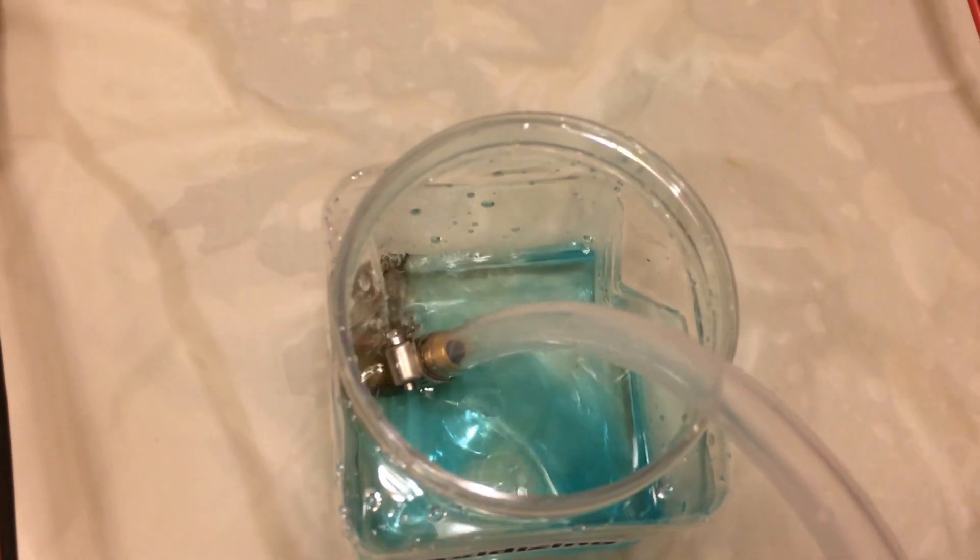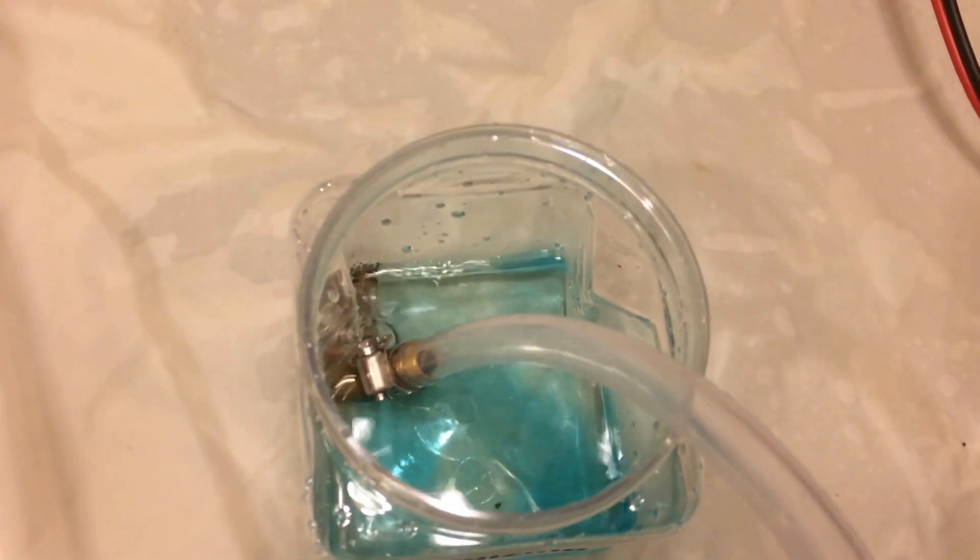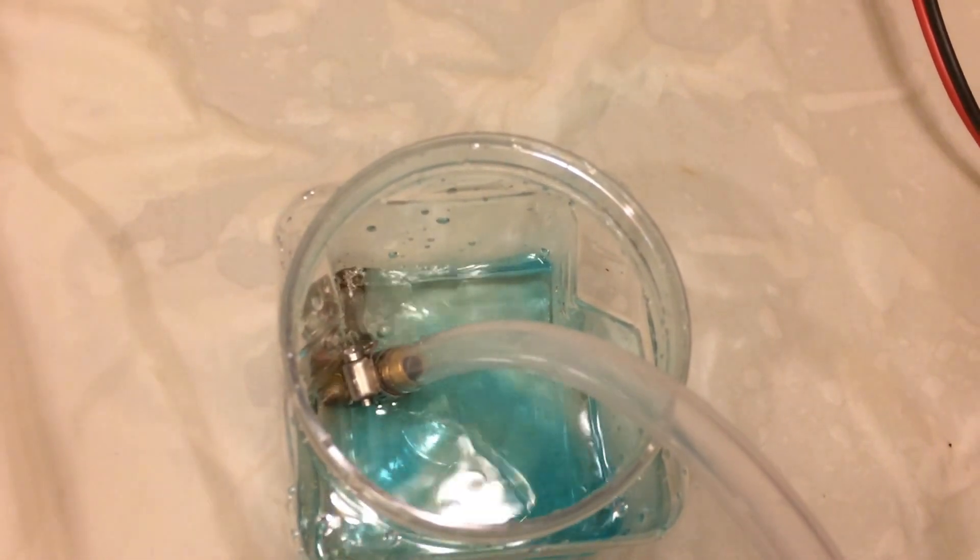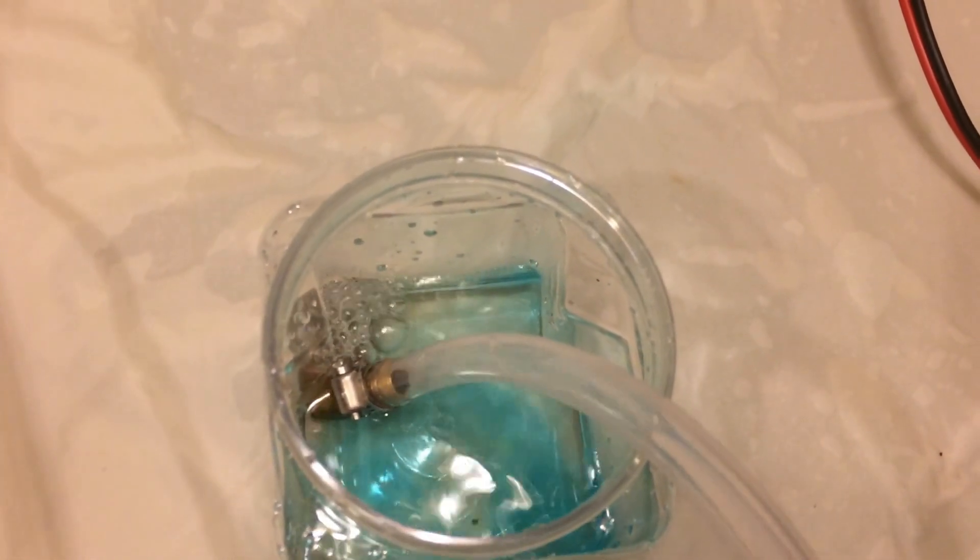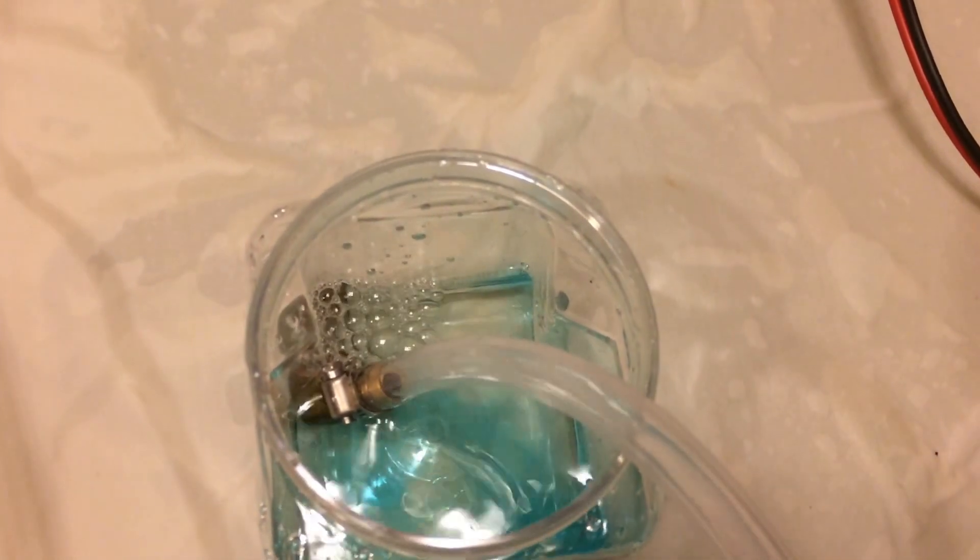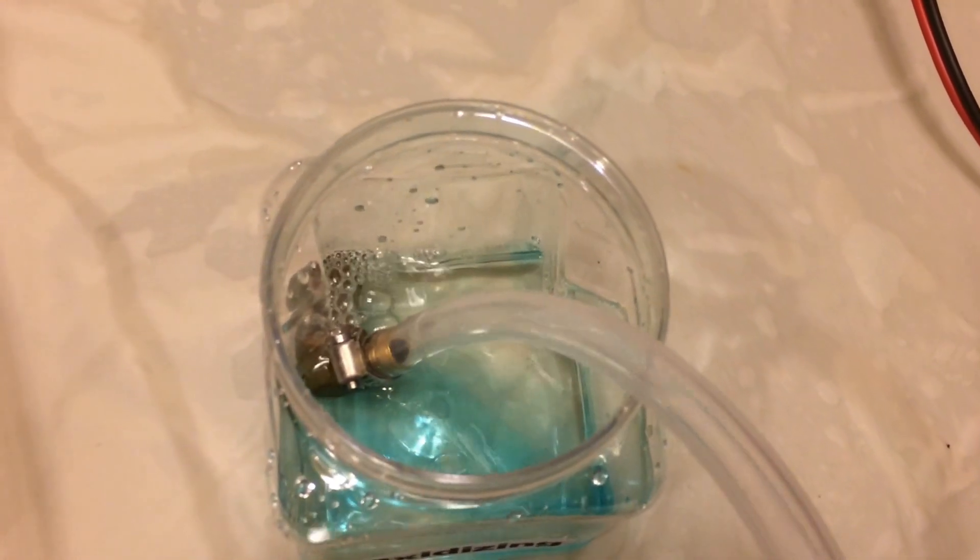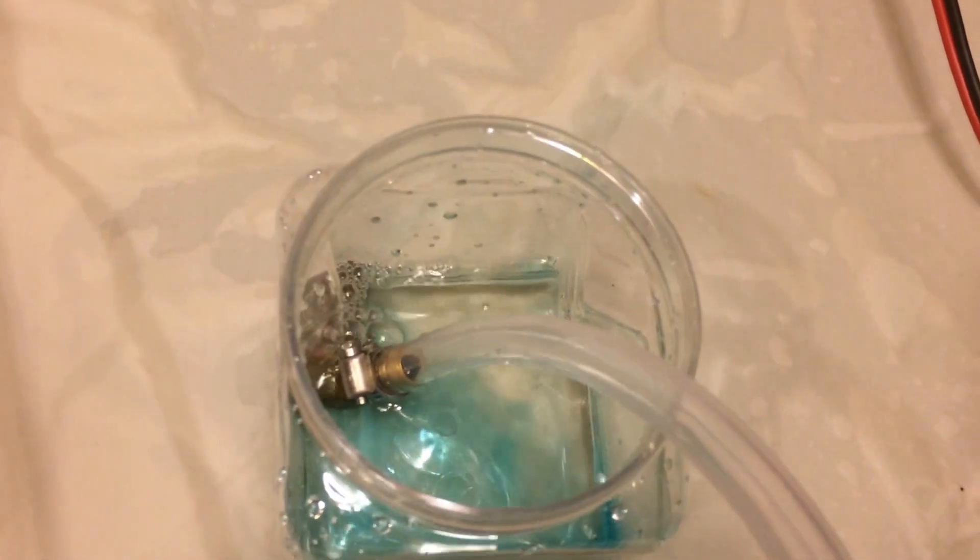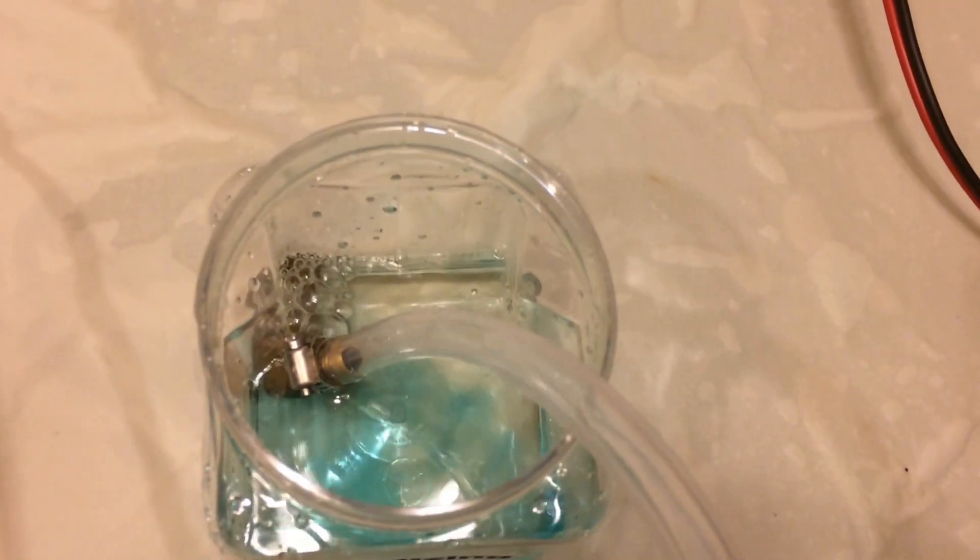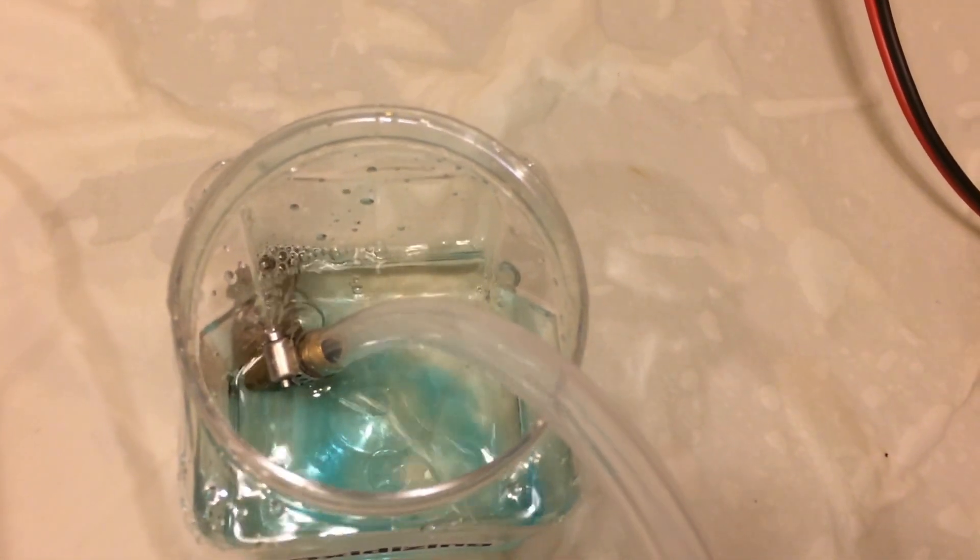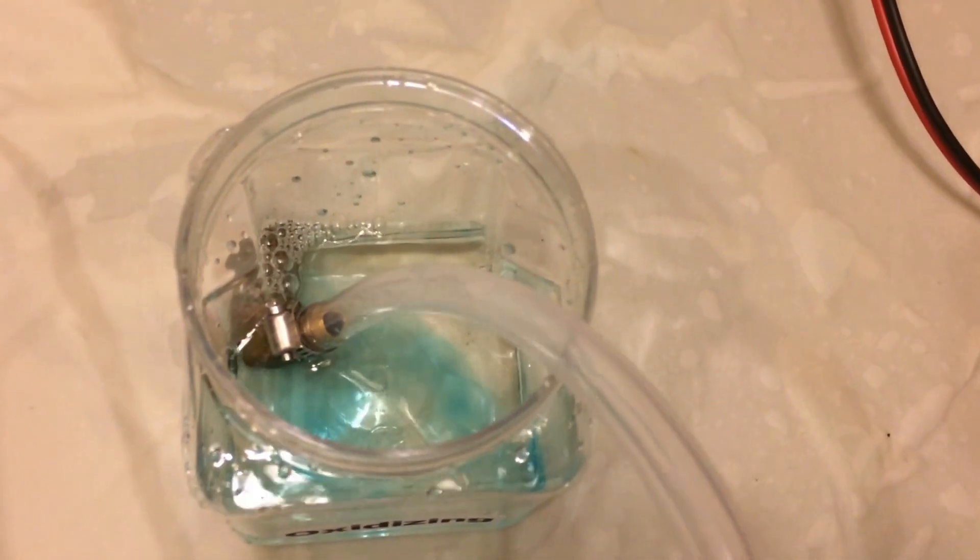Now that's the problem. It wasn't tight. That's why we weren't getting the current. That's why the current was going up and down a little bit. It's starting to lighten up pretty good.